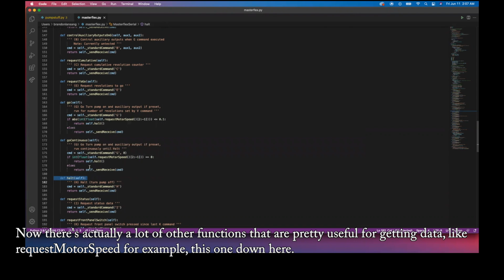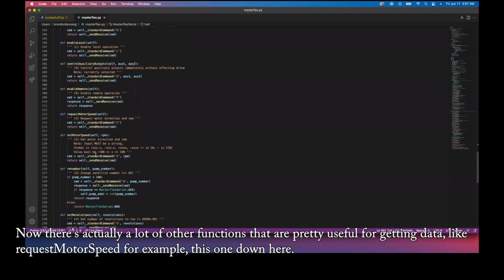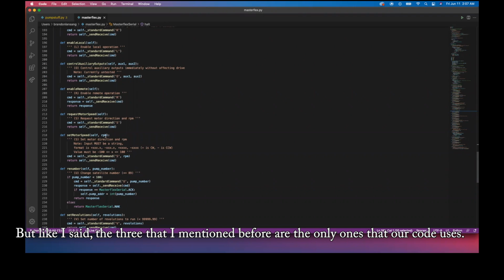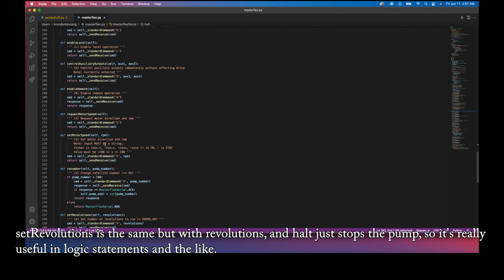Now, there's actually a lot of other functions that are pretty useful for getting data, like request motor speed, for example, somewhere down here. But like I said, the 3 that I mentioned before are the only ones that our code uses. So set motor speed does exactly what you think it's going to do. You just need to pass it the pump object that you're using as well as the RPM that you're requesting. Set revolution is the same, but with revolutions, and halt just stops the pump. So it's really useful in logic statements and the like.